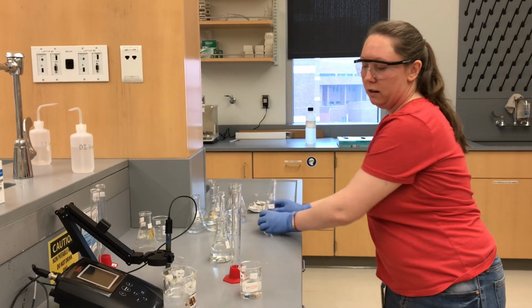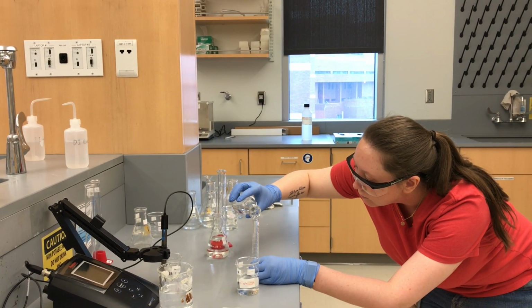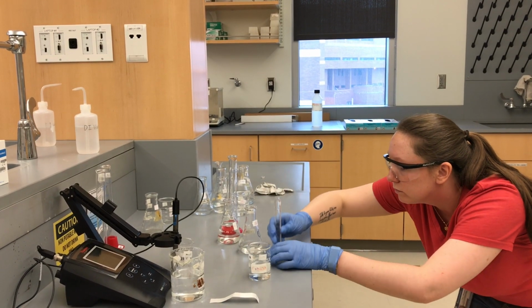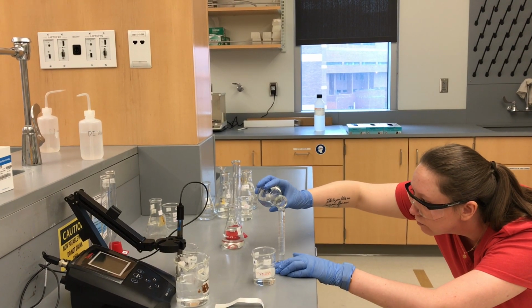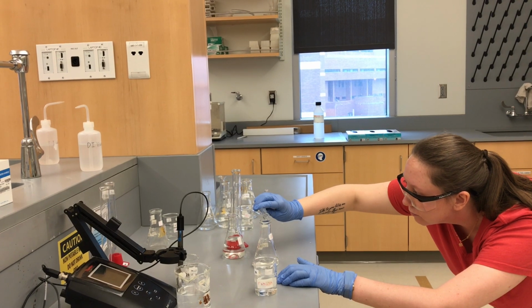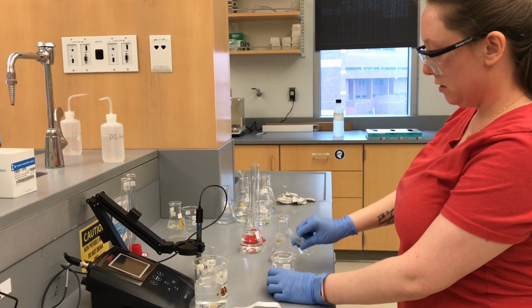And we need our OH minus. Nice. Okay, so 2 mils of NaOH.